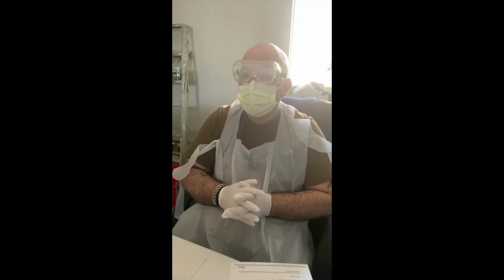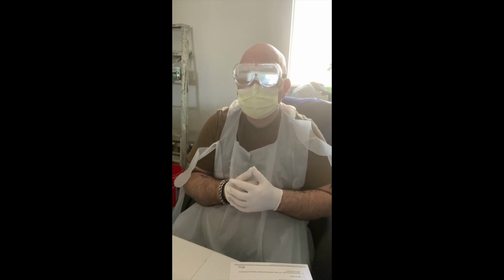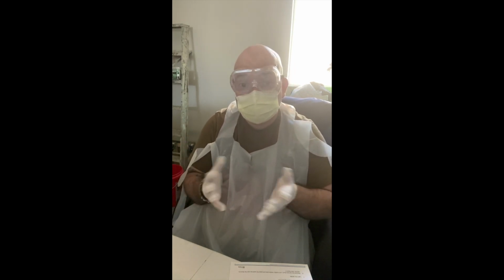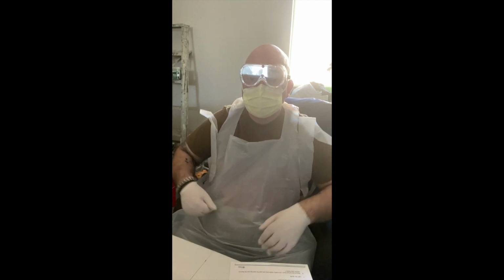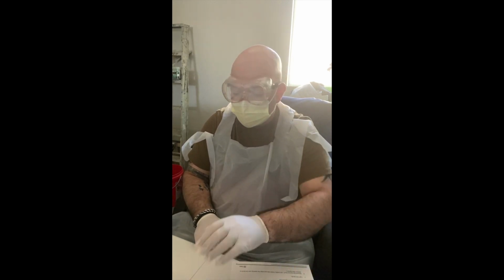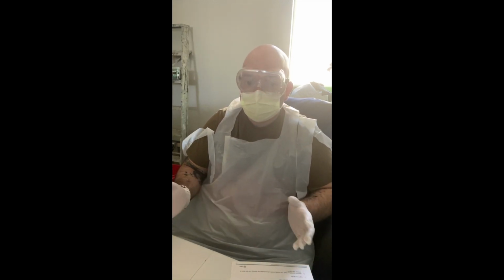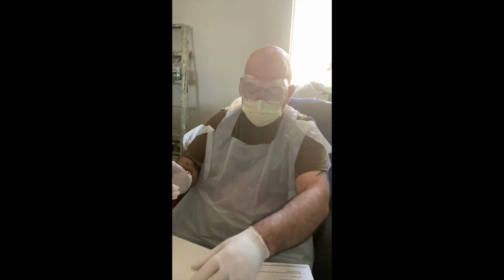In today's lab, I'll be inoculating, or in this case, stabbing cultures or growths or CFUs, colonies, that I previously grew on TSA or tryptic soy agar, into what's called motility test agar. So I wanted to quickly go through the supplies I'll be using for this part of the experiment.